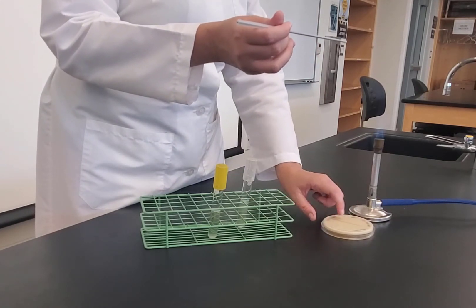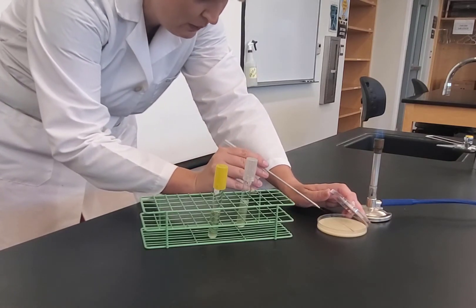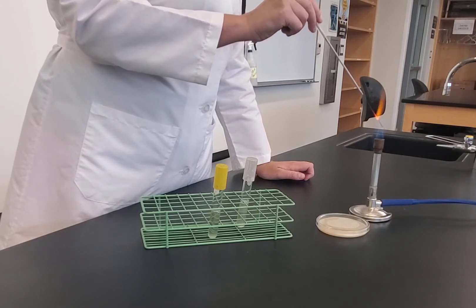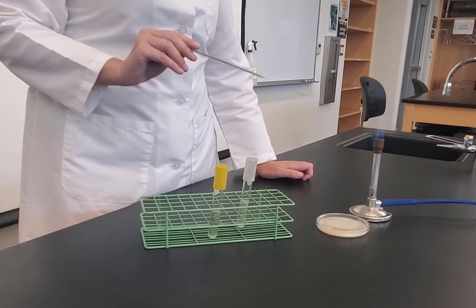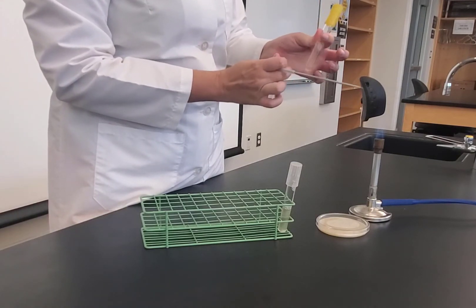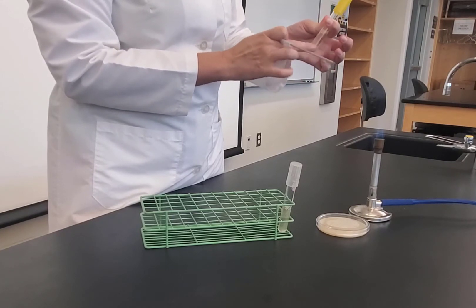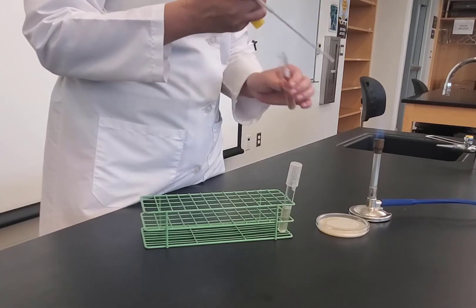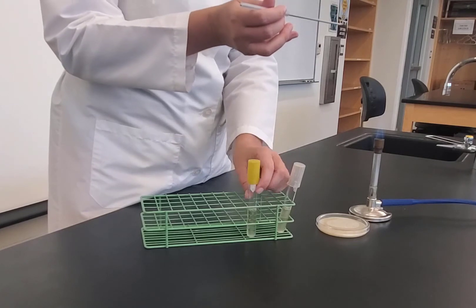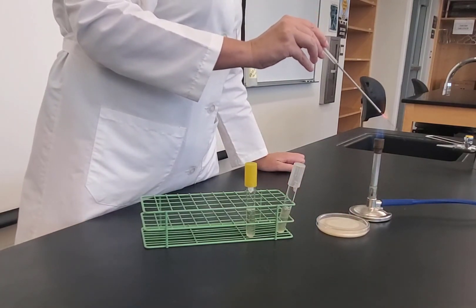Once bacteria are picked up, flip the plate over, keeping track of which side is BC. Open it like a clamshell and make one broad streak down that side of the plate — keep the loop flat and pull. Flame the loop again. Now repeat for E. coli: vortex, uncap, flame, pick up bacteria from the bottom of the tube, make one broad streak on the other half of the plate.